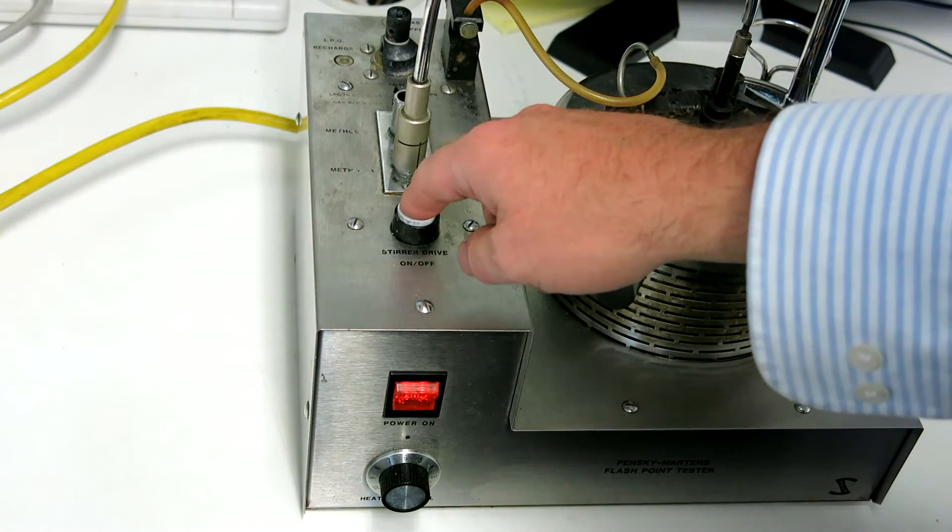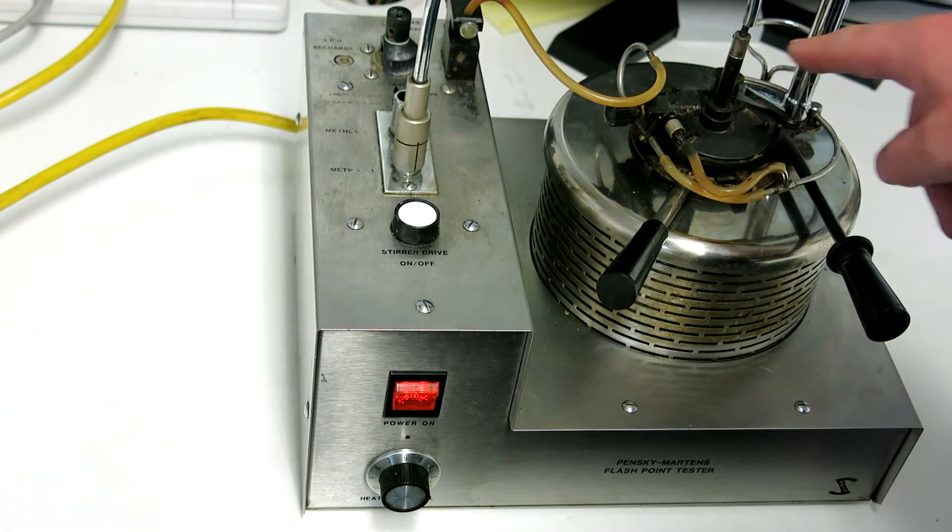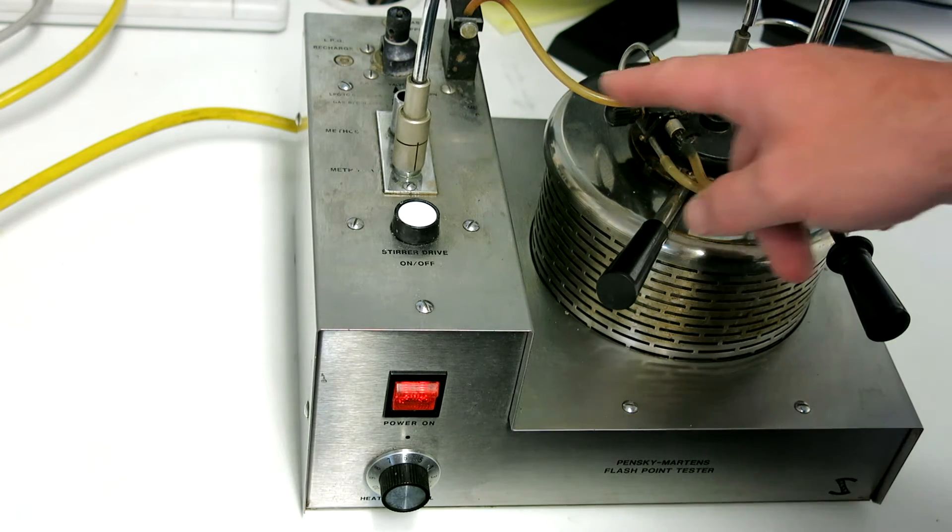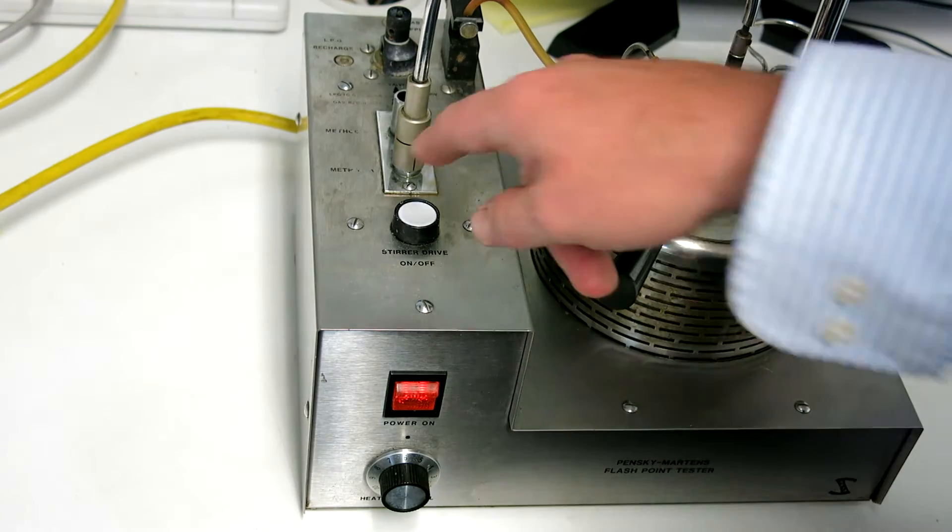What I'm now going to do is switch the drive on. You can see the drive rotating there, so that's moving merrily away there in the center. Okay, if we just switch that off.